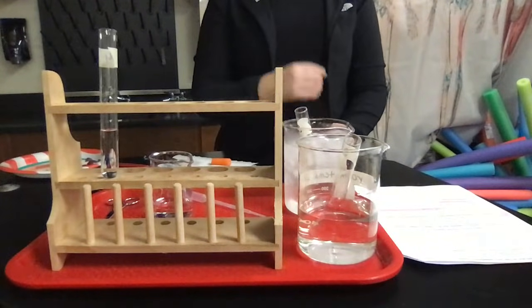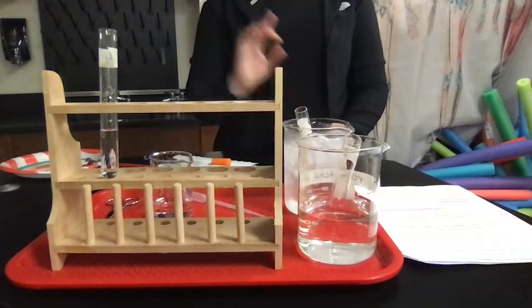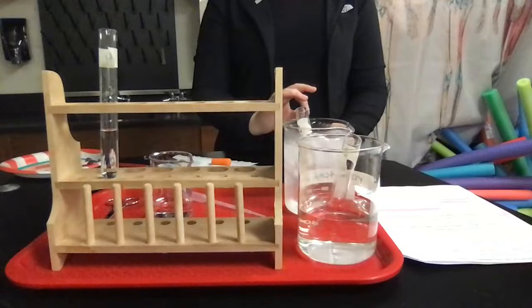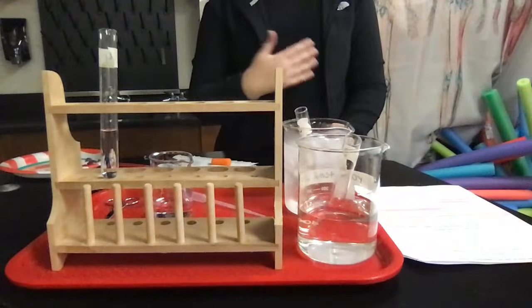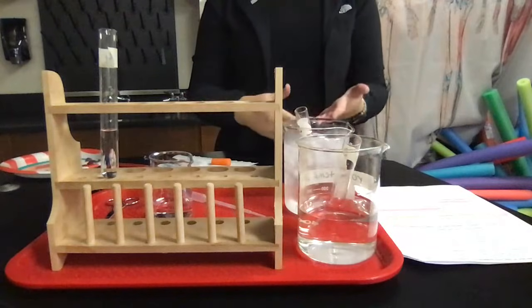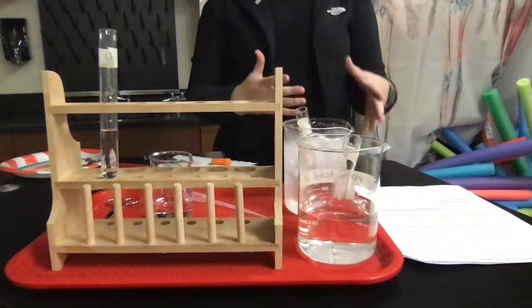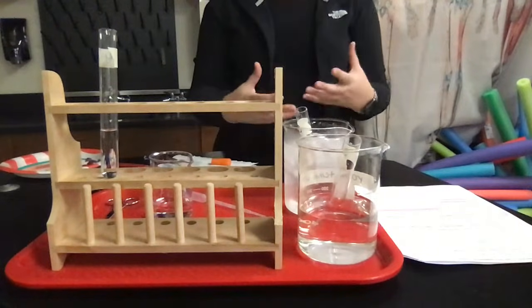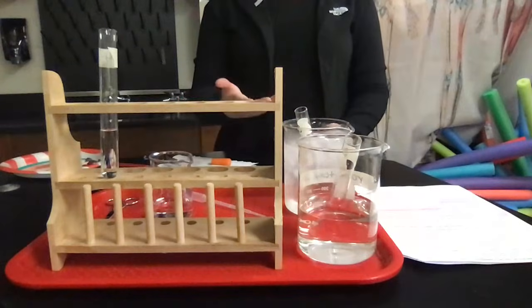And then we also discovered that the fluid left over after the reaction, when you put new enzyme into it, nothing happened because that was just water. And catalase does not break down water. It creates water from the breakdown of hydrogen peroxide. So now we're going to look at how temperature affects this reaction. We're just going to use the liver because, as you saw in the first part, the liver had the highest catalase activity. It's the easiest to see, easiest to measure.